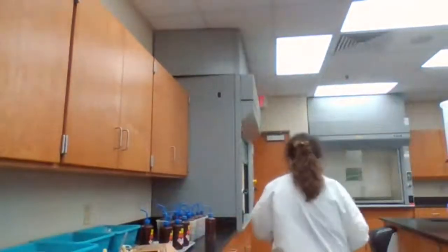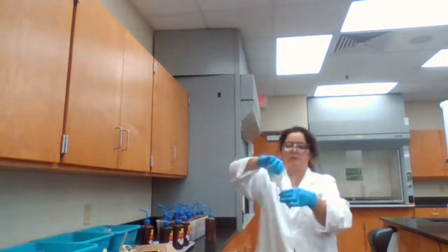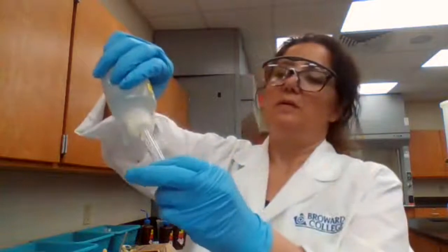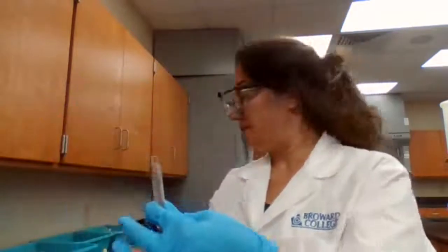Sorry. 3C1, HNO3, acidic, but HNO3. 15 drops of HNO3.